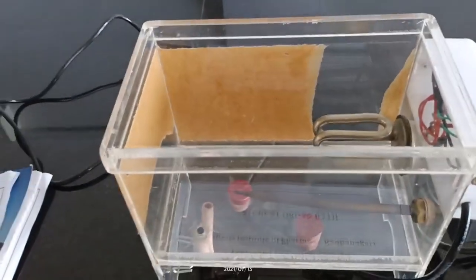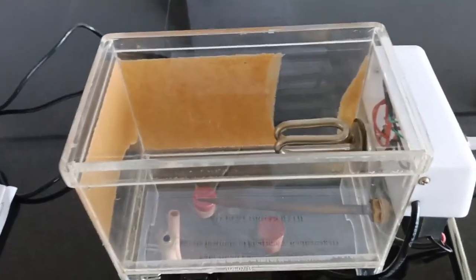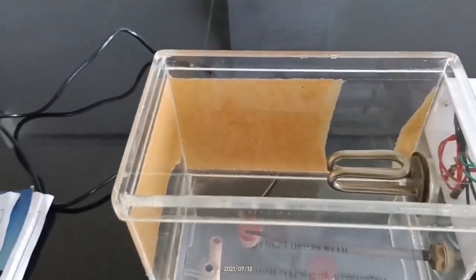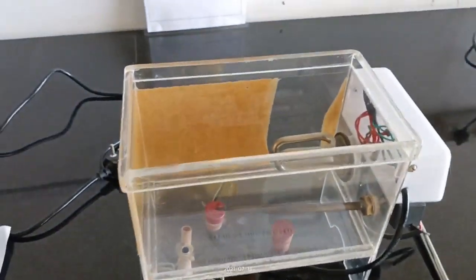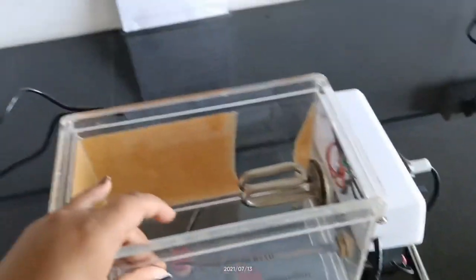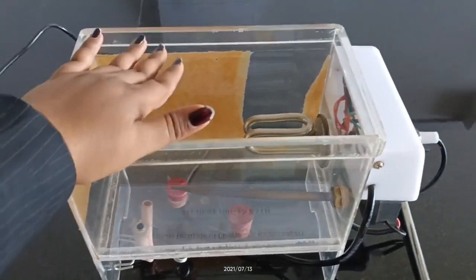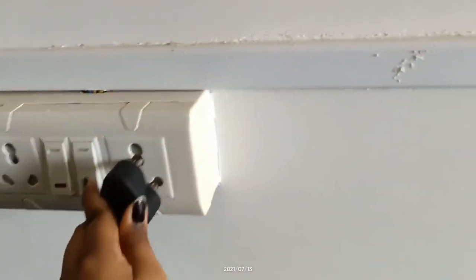Now you have to know how to operate the student organ bath — the standard operating procedure. First, clean the instrument with a dry and clean cloth. After that, fill the organ bath with water up to the required level. Then plug in and switch on the organ bath.